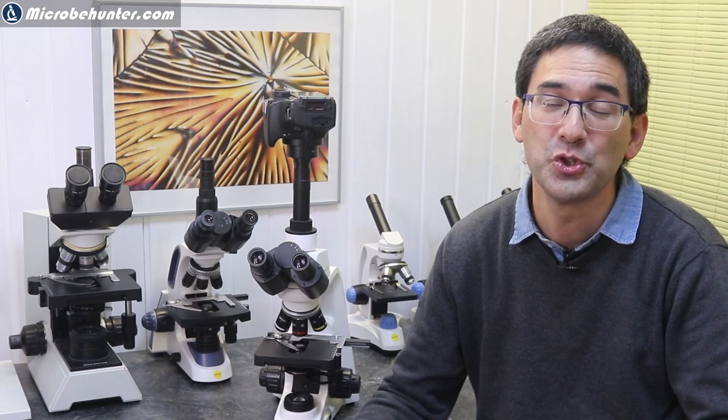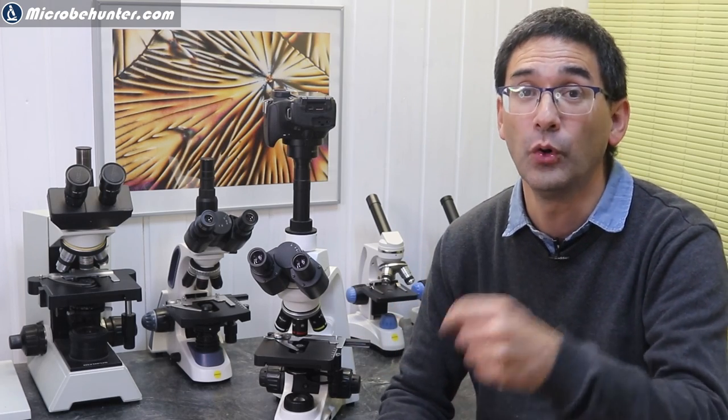If you want to connect to a computer, don't forget you need computer space next to your microscope, and be careful not to spill any liquids on it. If you don't have a DSLR but a small microscope camera that plugs in at the top, you'll likely have to go the USB route anyway, since many of those cameras don't have an HDMI connector — though some more modern, more expensive ones do. If you're thinking about buying a microscope camera, take into consideration whether you want to connect it directly to a screen or via a computer.